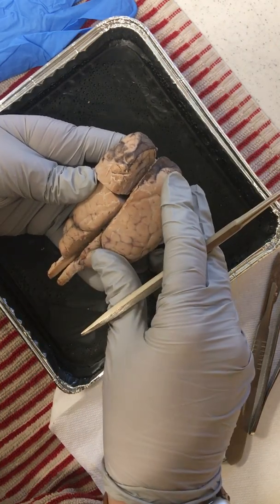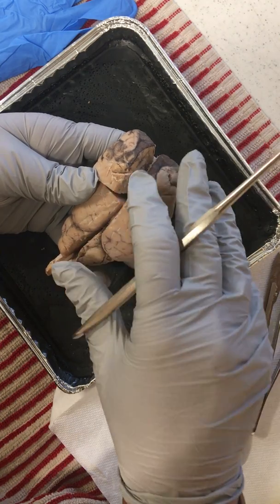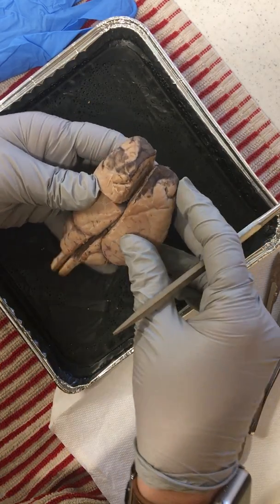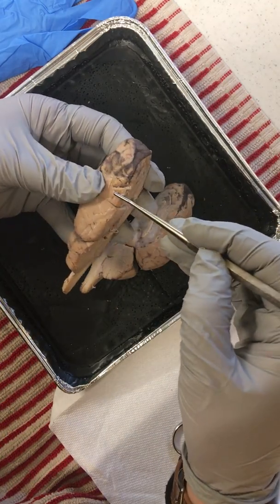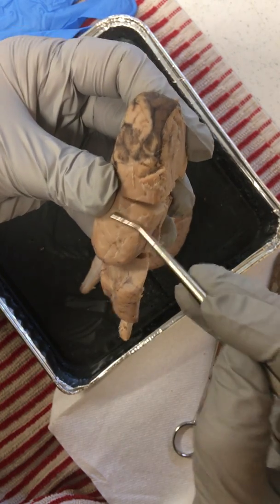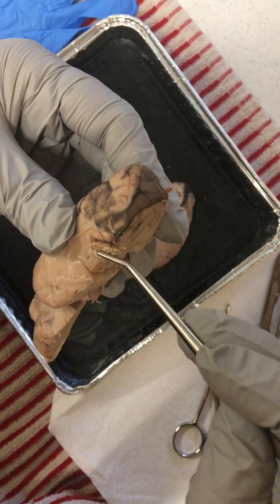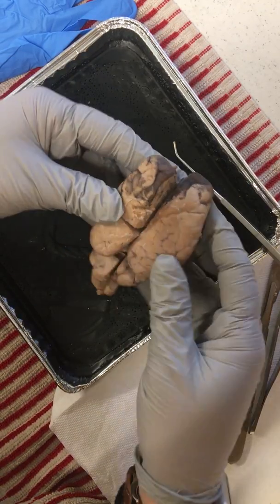And then the mid layer is called the arachnoid layer. That's a little bit of a web-like structure that adheres to that dura mater. And then ultimately there's the pia mater, which is that very tender third layer, the innermost layer of the brain. Here I've taken away a little bit. You can see with the layer you're not able to puncture those different folds of the brain, and it doesn't work. But as soon as I remove that thin little layer of pia mater, you can see how easy it is to compromise that brain and that fold. So those protective layers are extremely important, of course.